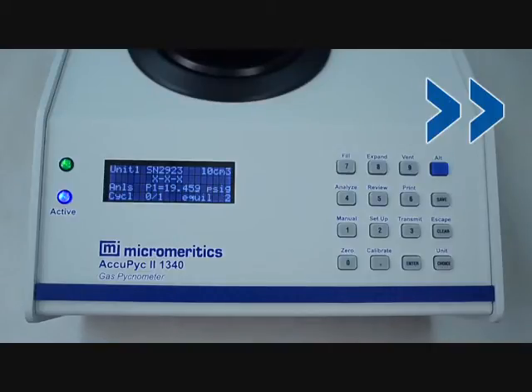This is the first equilibration cycle for P1. The expansion valve opened and now it is equilibrating P2. The expansion valve opens, ending that analysis cycle. It is now going to go through the zero process again of zeroing the pressure reading.